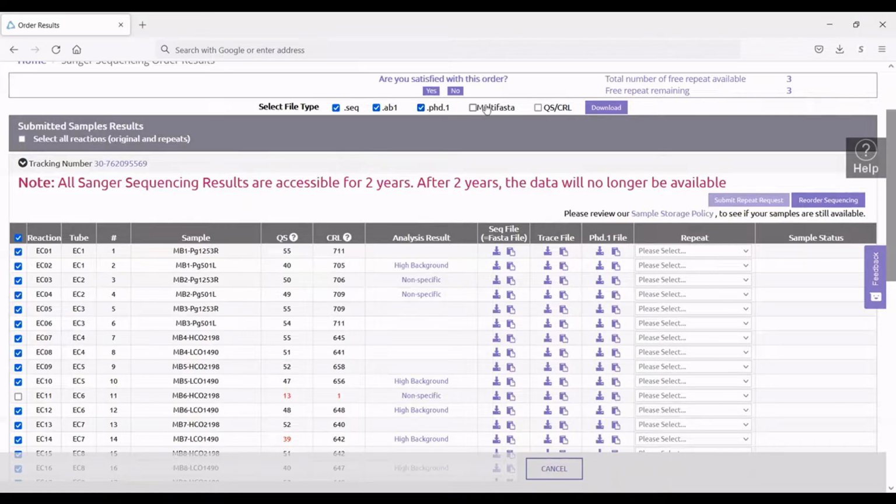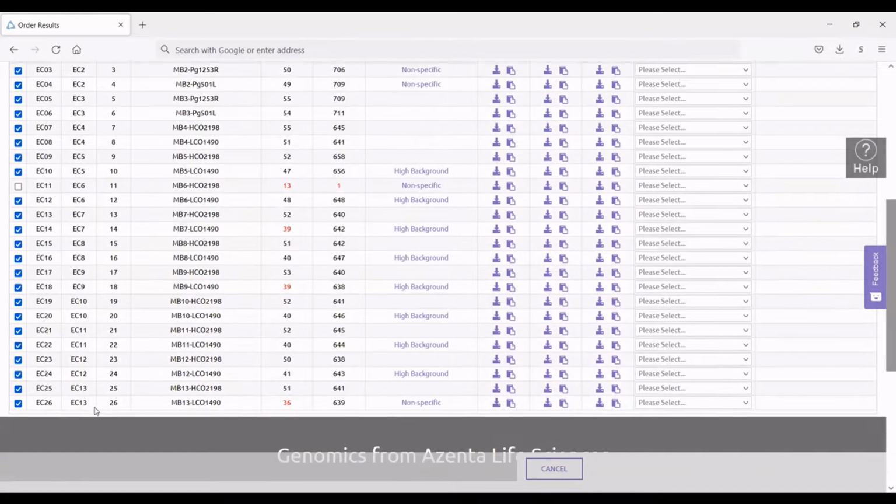You can also create a multi-FASTA sequence file, which puts all of the sequences obtained into a single file. You can also export the quality scores and contiguous read lengths as well. However, I personally just write these down in my lab notebook because it's just easier for me that way. And once you're ready, you can hit download, and those will be put into your download file as a .zip folder. So what you'll do is you will extract those files. It creates three different folders. It puts all of your FASTA files in one folder, all of your trace files in another, and all of your PHD1 files in another. So they're kept separate. And so you'll have all of the individuals in each one of those folders.